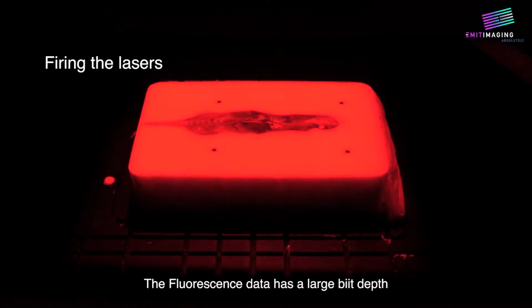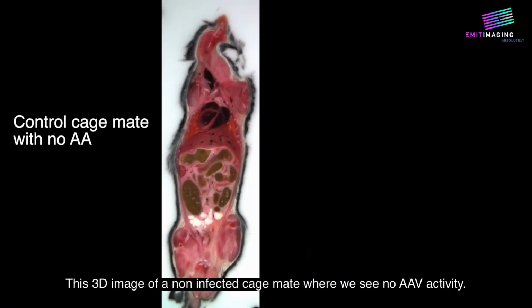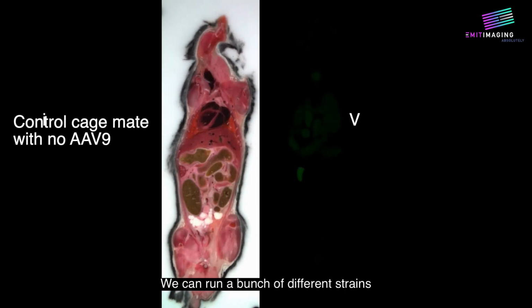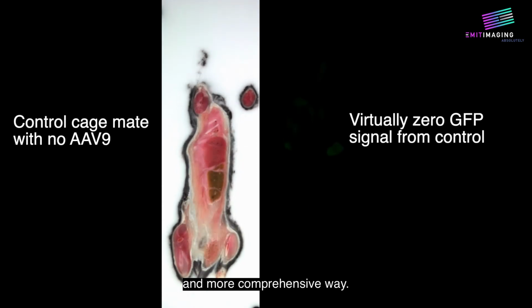The fluorescence data has a large bit depth to allow us to see very low-intensity signal areas. This is a 3D image of a non-infected cage mate, where we see no AAV9 activity. We can run a bunch of different strains of this AAV9 therapy on different subjects and compare variants in a much easier and more comprehensive way.